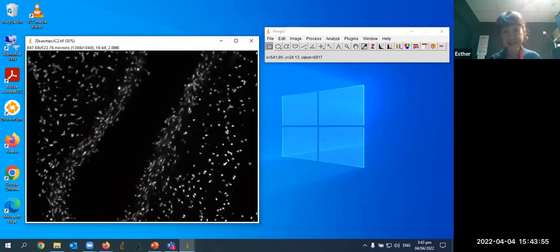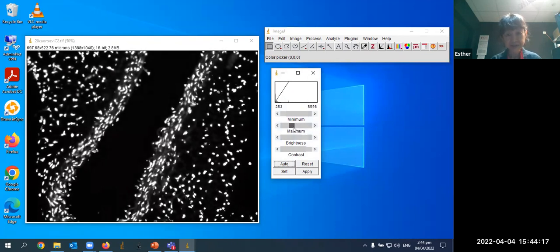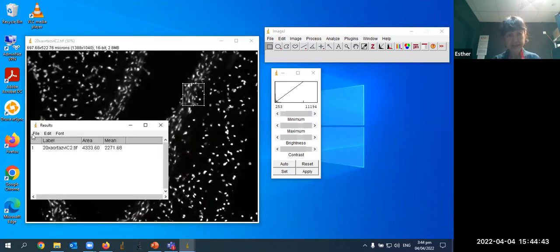When we want to adjust the brightness of the image, we can use this tool, which shows the histogram. This is the brightness or intensity levels on the x-axis, number of pixels of that level on the y-axis. If I want to make the image brighter, I can always change the display maximum to make the image brighter. This does not change the actual intensity value of the pixels in the image. So let me just show you by taking some measurements. For example, if I draw an ROI of one part of the image, let's say here, and I measure the mean intensity. So the mean intensity of that area is 2,271.